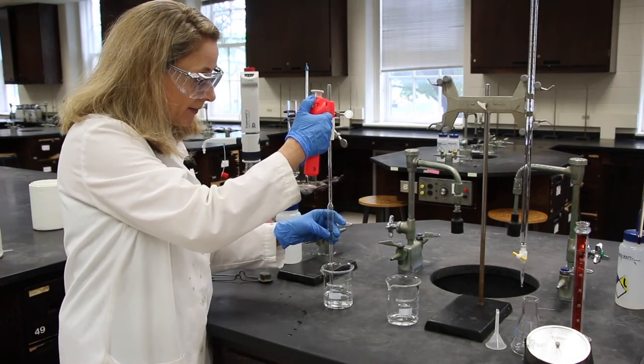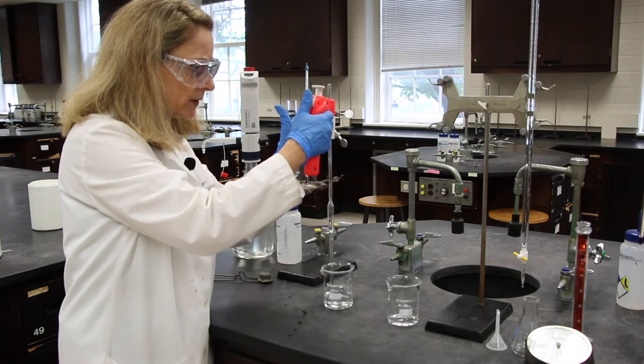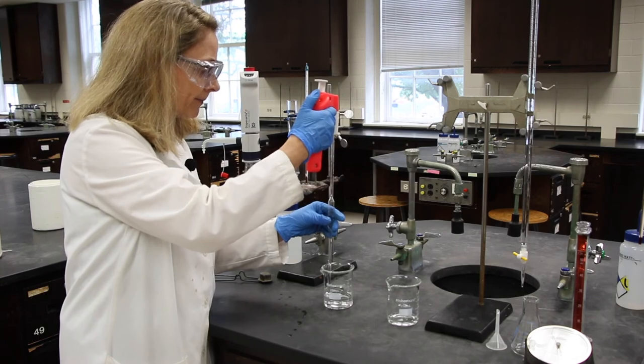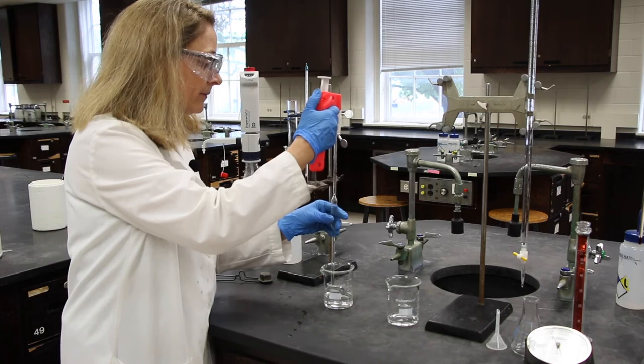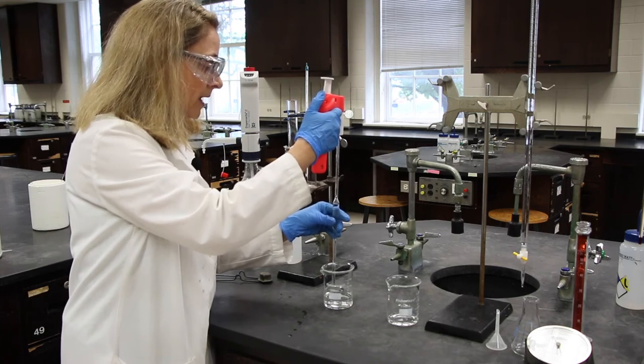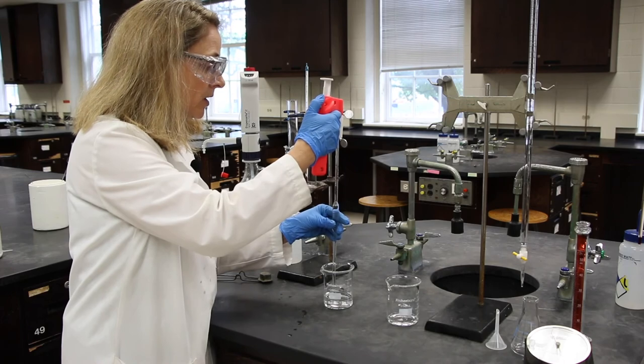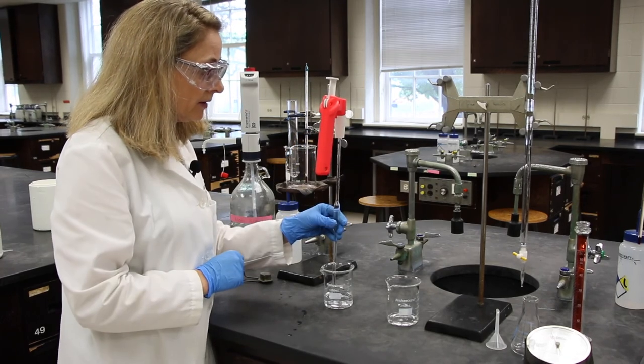Now we're going to draw it up again. And be sure you don't draw it up so that liquid gets into the auto-pipetter. That can ruin the auto-pipetter and your experiment.